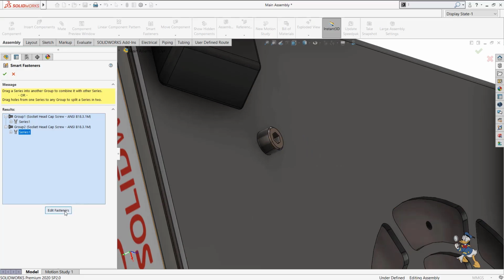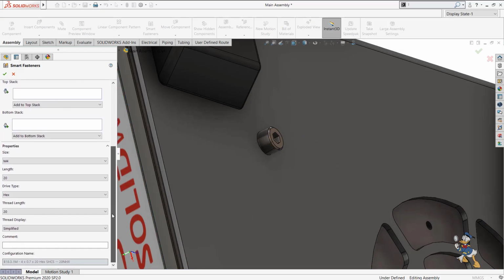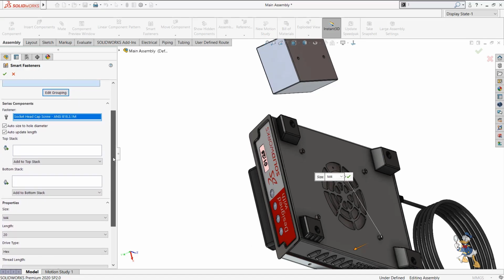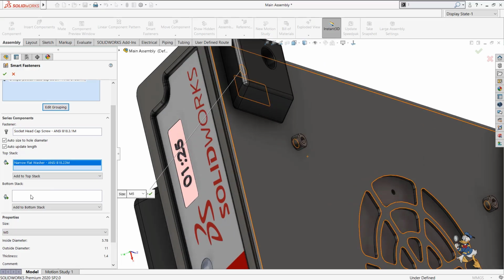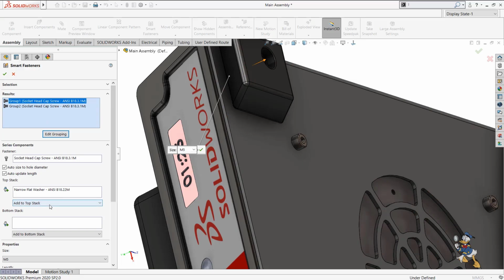So now we have edited the smart fasteners, and suppose we need to define the length, the type of the fastener, and a simplified or cosmetic or schematic fastener, we can add it over here. So these kind of facilities are available in it, and suppose we need to add some sort of washer, so we can add a washer itself over here by selecting a washer facility. Suppose I need to add a washer facility to this one as well.